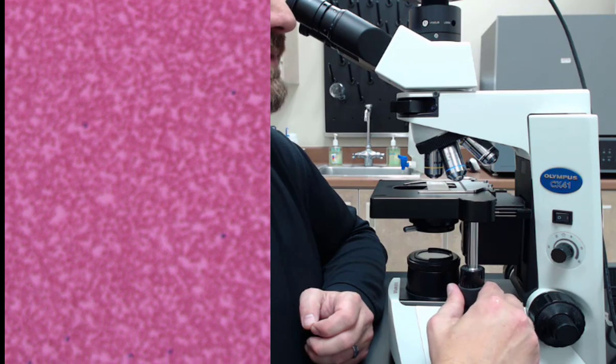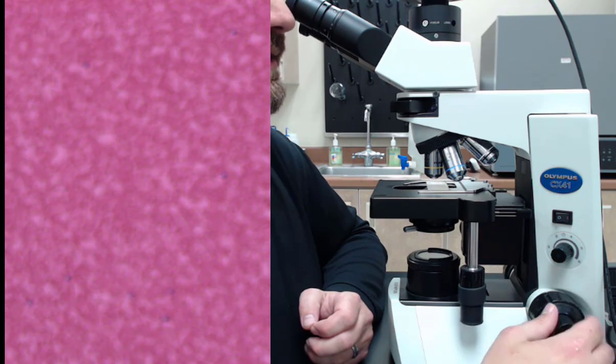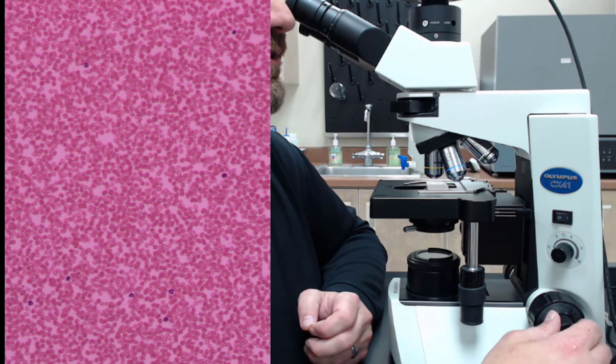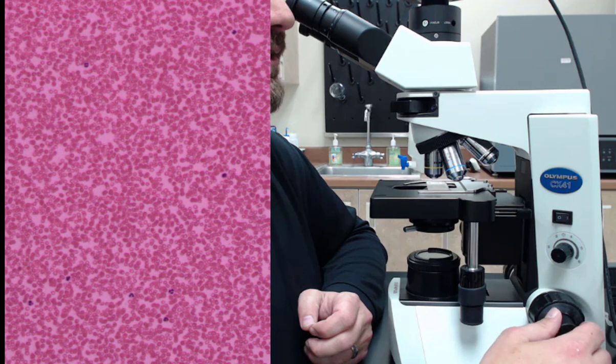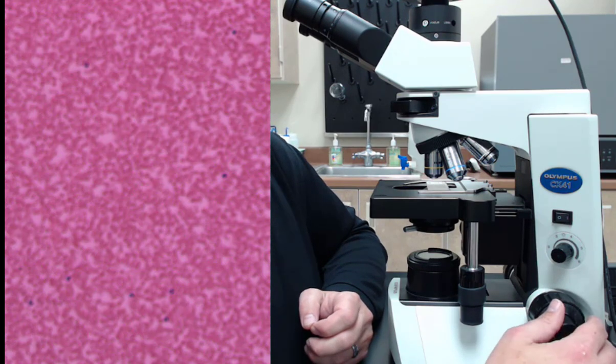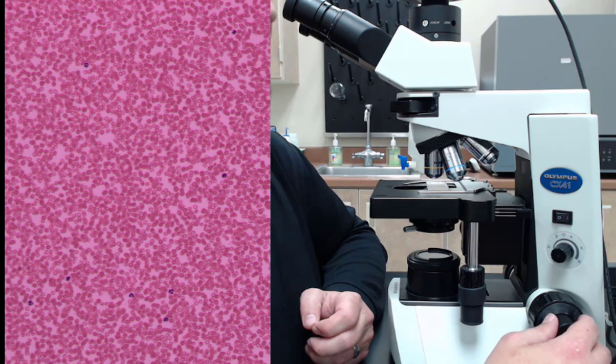All right. So same thing. I get it where I think it's in focus. I use my Goldilocks strategy to purposely take it too far out of focus both directions. And that's why I do so. I kind of like the eye doctor, like, is this better or this better? Well, they both look pretty good, right? Where I have it here, and then just a little bit of difference. But if you get it super crisp, you're going to thank yourself later.